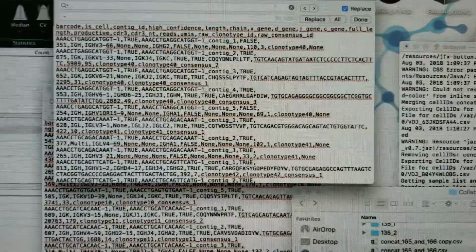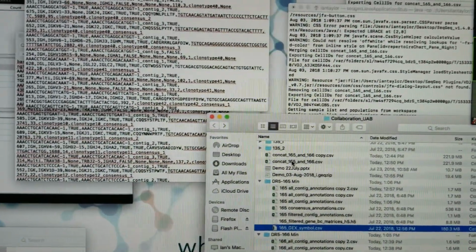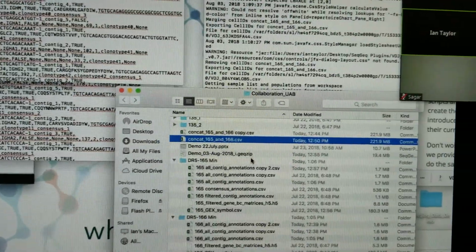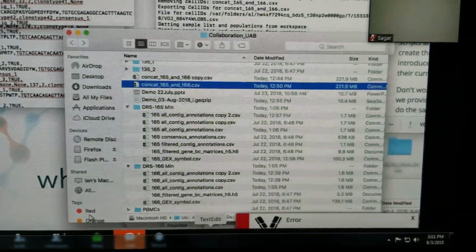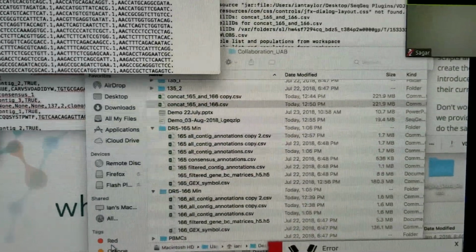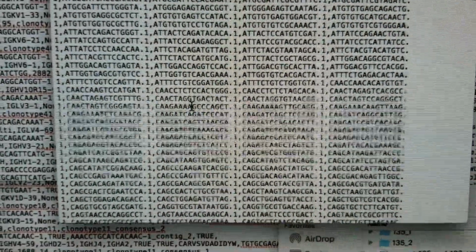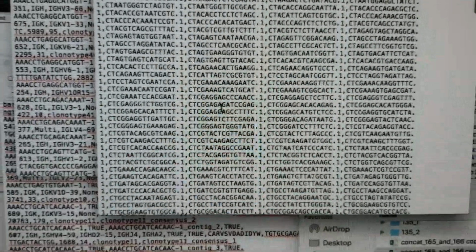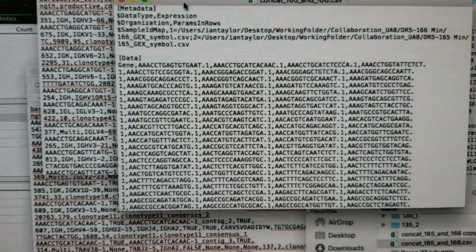Oh, I see, but this is not the concatenated file. Let me open up the concatenated file. So there's our concatenated data file. This is a combination of both files 166 and 165. And if I open them up in a text editor, I can see that each of those barcodes has an oligo tag followed by .1. So we need that to match what's in our metadata file.